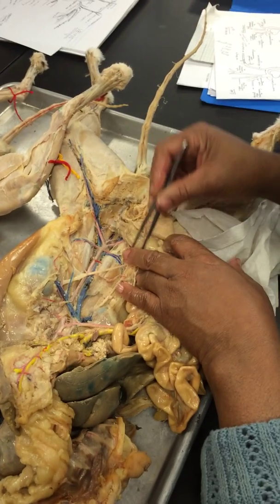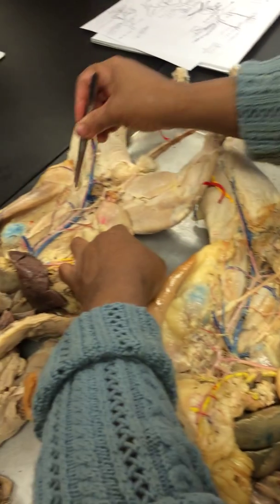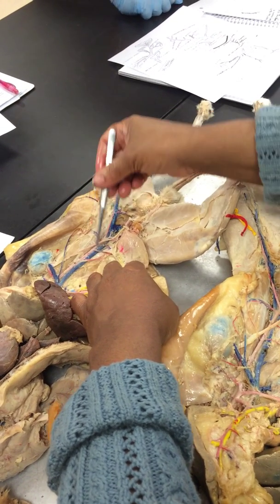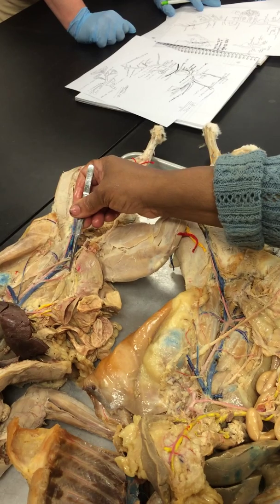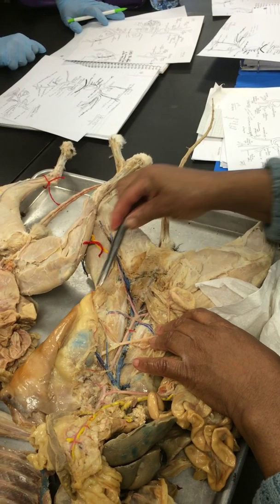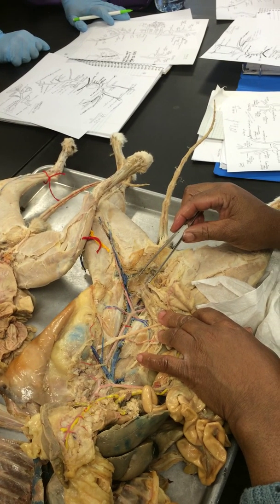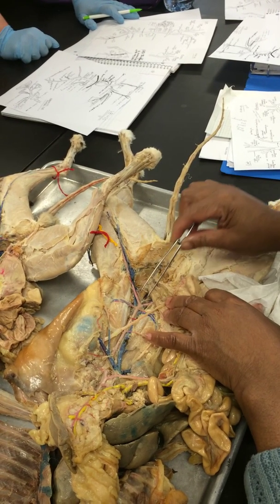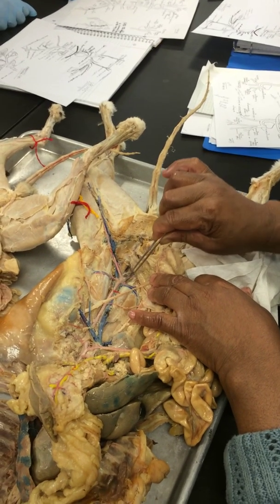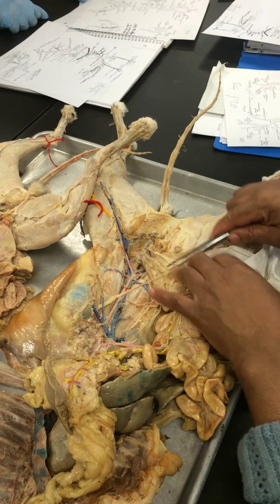Come on down, and you have a singleton, and this one got busted. So you can see it here. This singleton here. This one is the inferior mesenteric. And then you come on down and you have a pair. That's this one right here. Those are the iliolumbar. And you have the artery, and it sits right beside the veins. You can see the blue ones nearby. This is one of the few places where they come together.